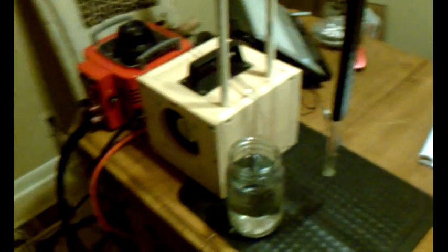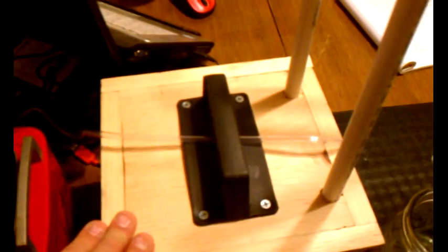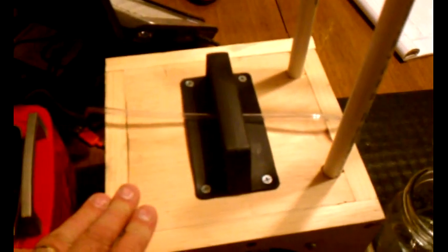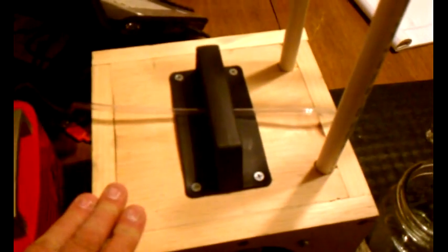Alright, this is my new setup. You can see I have put the electrodes together right here to create the up and down electrode holders instead of side to side. You'll see why once I put the gold in. I got it attached up in here with this contraption. Inside of this I have a microwave oven transformer, 1100 watts.